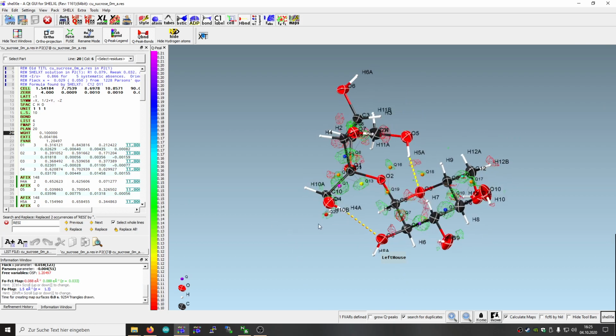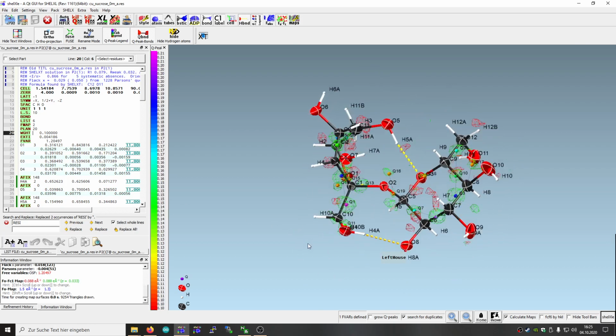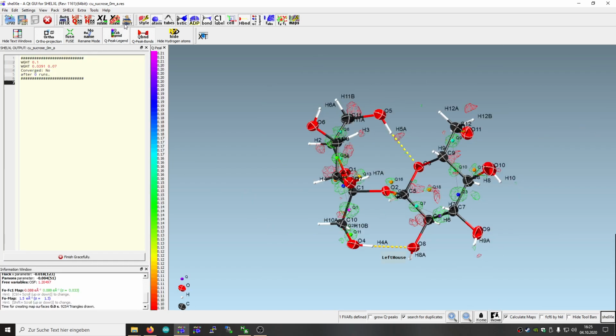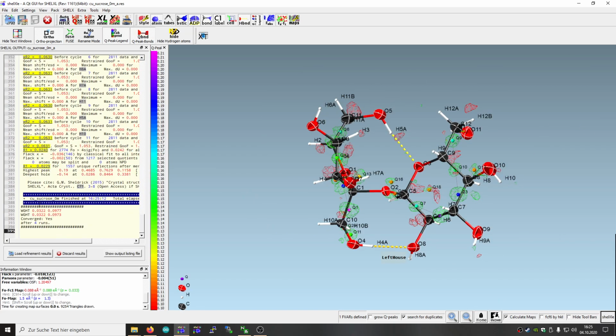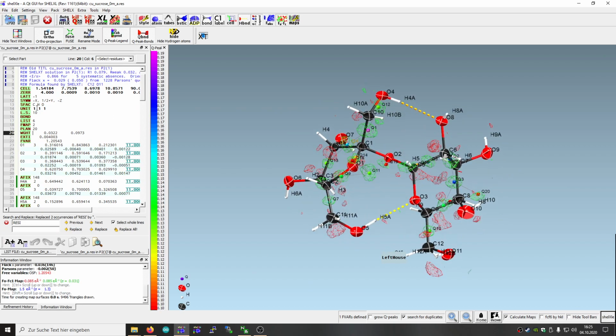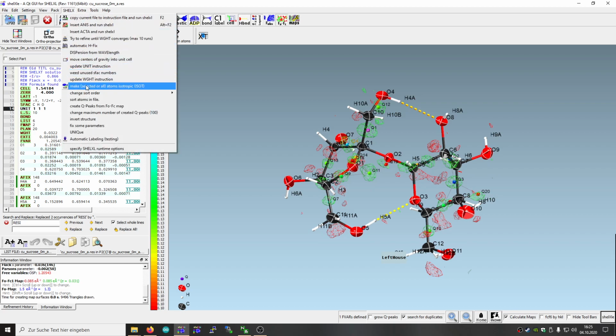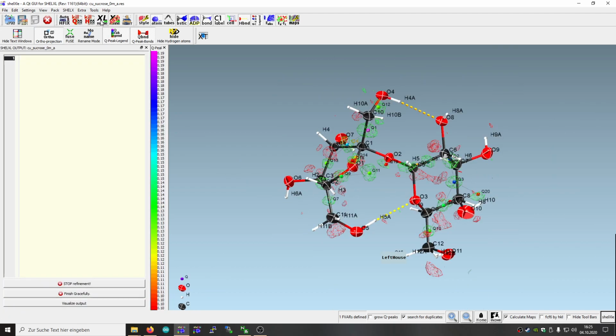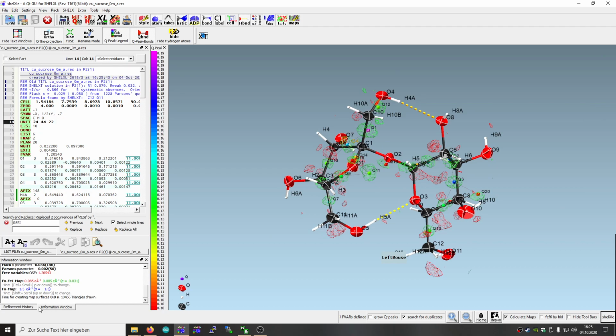Yeah, seems to be that there would be a little bit of extinction, and so we finalize it again by hitting refine weighting scheme until it converges. So we find that as well here, and yeah, save that. And again, here our list is incomplete or not correct. So the unit is not correct. So we just say update unit instruction. So that shouldn't change much in the refinement.